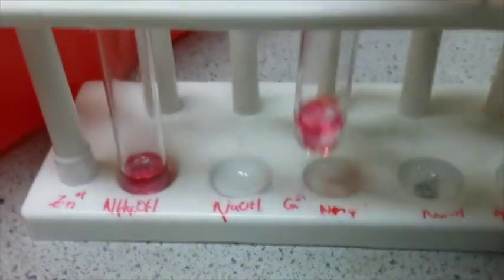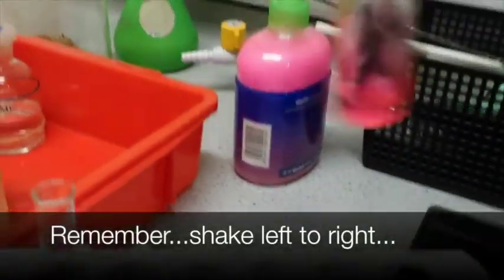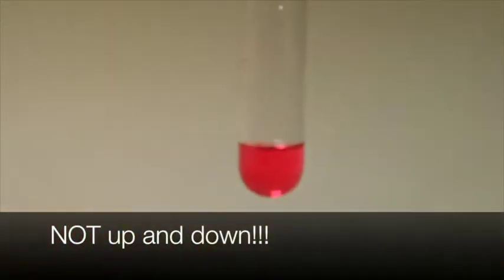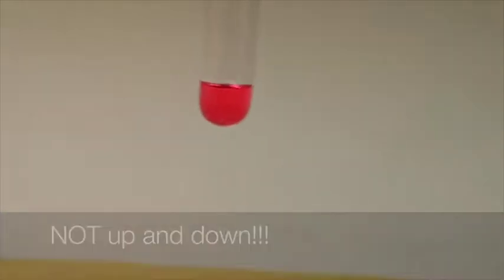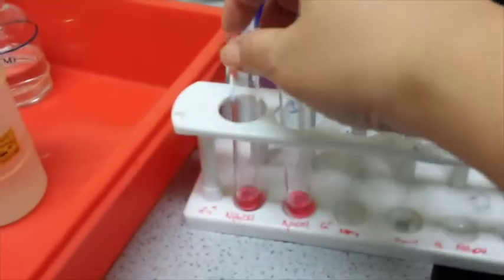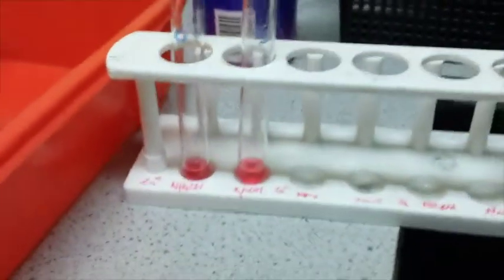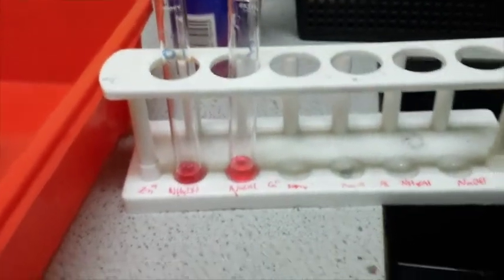As you can see, pick it up and gently shake it. You will see that it changed into a bright pink, which indicates that we have hydrochloric acid and it is a pH 1. And we are going to figure out if the concentration of a substance affects the rate of neutralization.